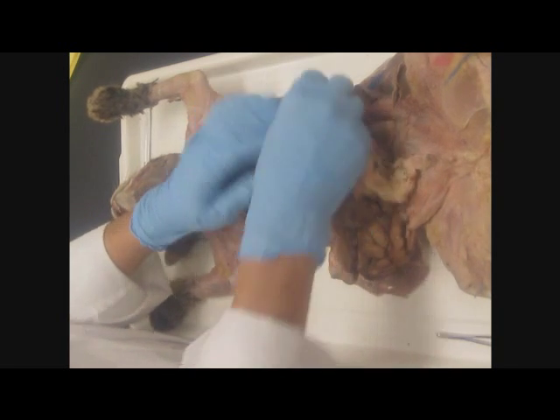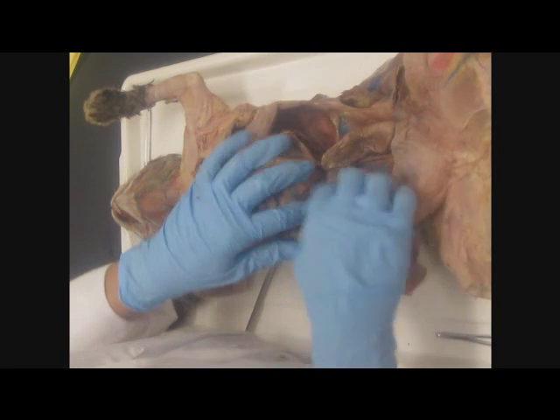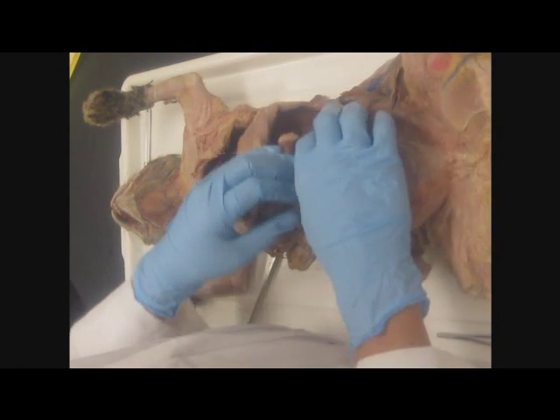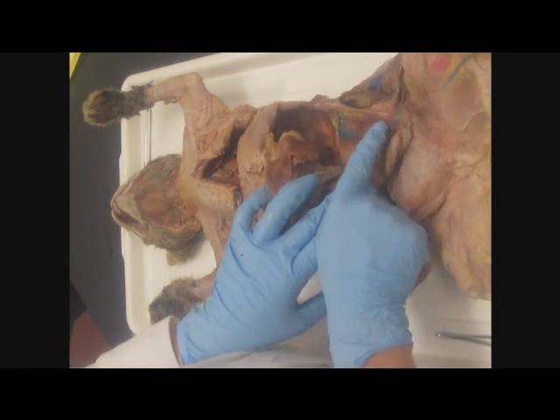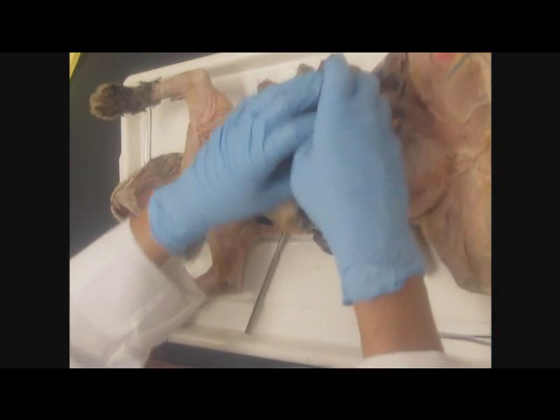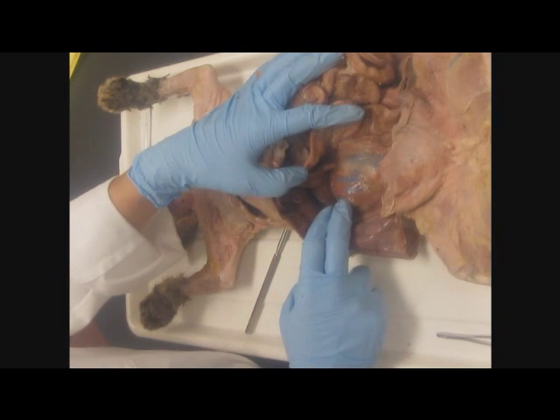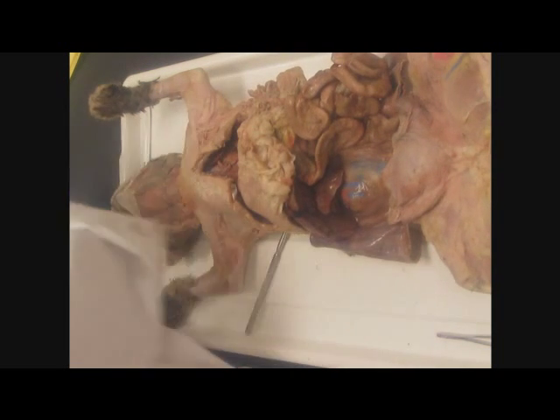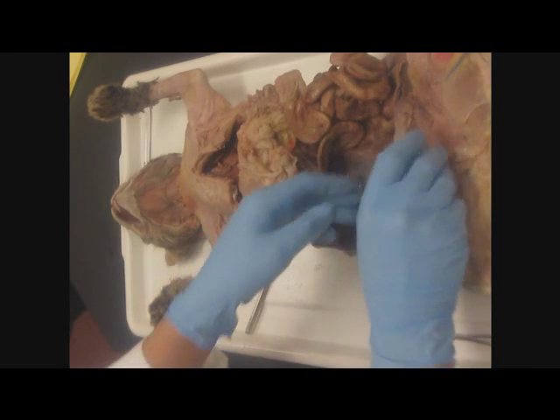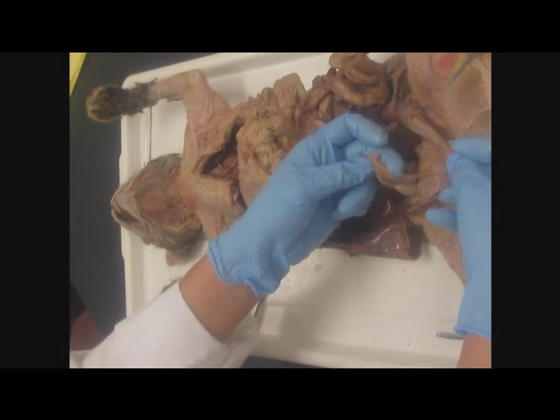Spleen. Small intestines, we showed you that. Large intestine, along the back of the body wall. Okay. And then we have some kidneys. We've got a right kidney, which is still covered by the peritoneal membrane. And we're going to open that up in the next dissection. And then, sorry, that was left kidney. Right kidney over here, which is a little bit hidden by the liver. Okay. Then we have urinary bladder. We showed you with cavities, and that's tethered to that muscular wall by the median umbilical ligament.